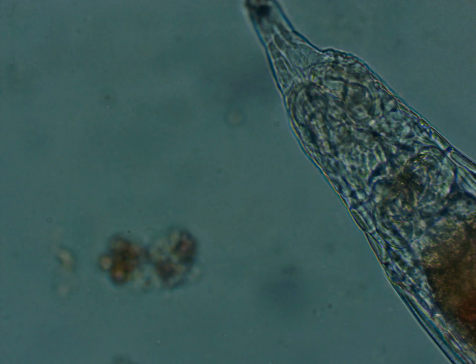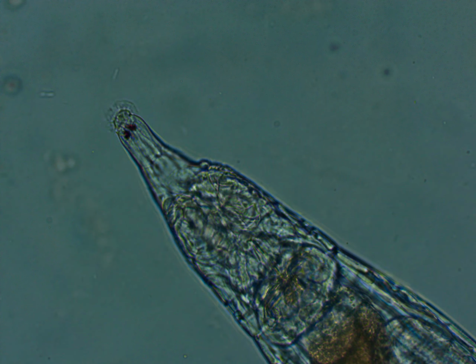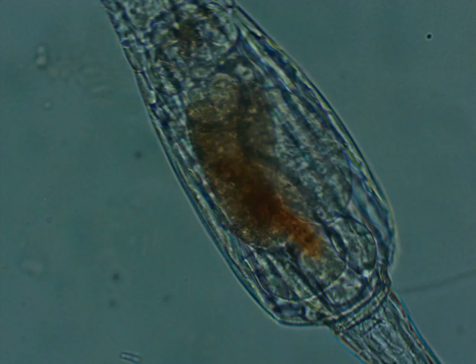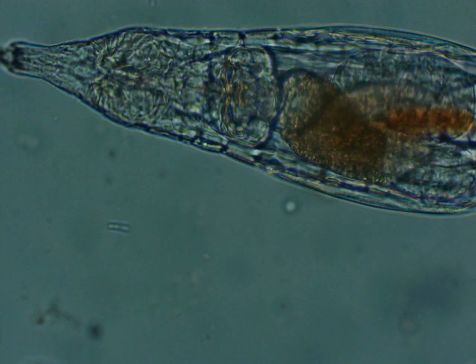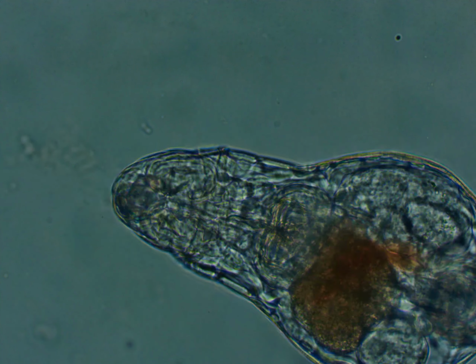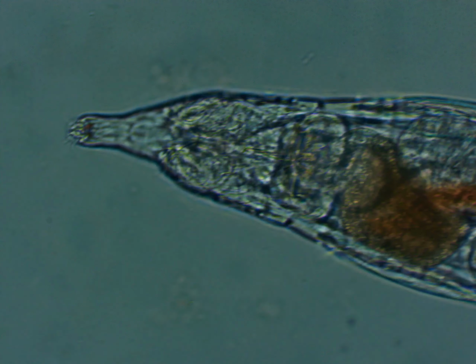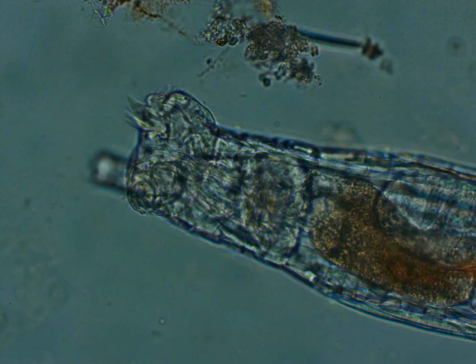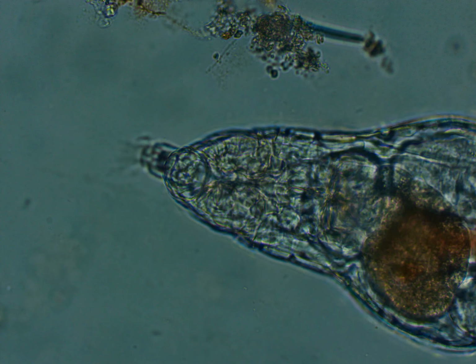So here is my 40 times objective bright field footage of it. You can see its eye cells. They're single cells, not any compound eye, or eye that has several cells like on humans, insects, crustaceans, or other living organisms that have multiple cells. They don't have the sorts of rods and irises or pupils that we have on our eyes, but now you can see it extending its cilia right there.